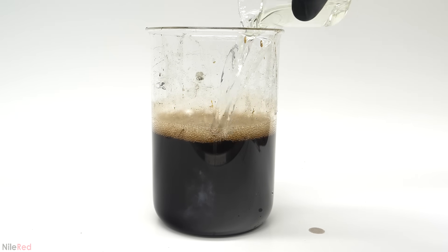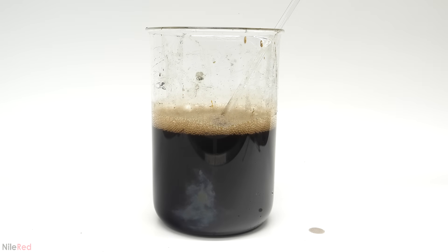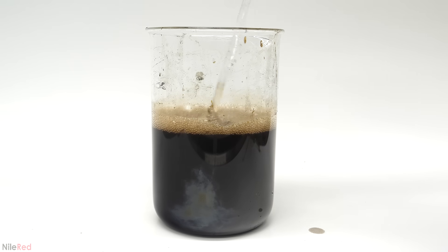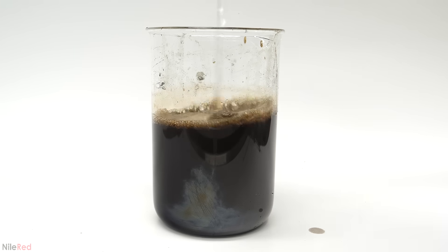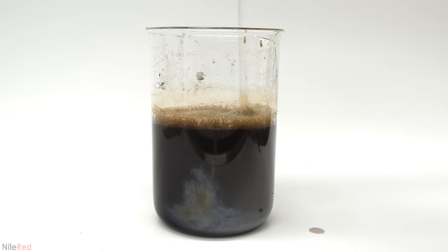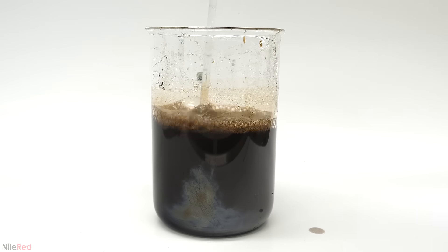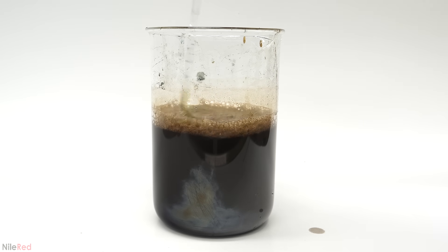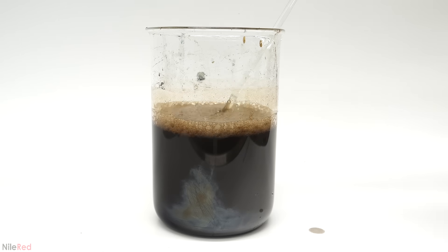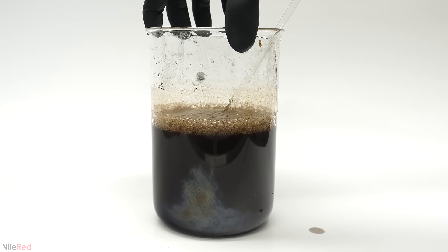It was a bit hard to tell, but after a while, a lot of solid had separated. To see if it were done, I took out a small sample, filtered it, and added more bleach. I didn't film that part, but nothing ended up coming out, so I moved on to filtering. This was just done through a coffee filter, and a nice yellow-colored solution came through. I'm not entirely sure what exactly was causing the color.